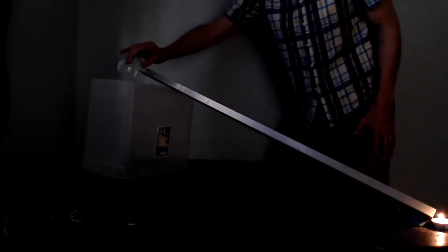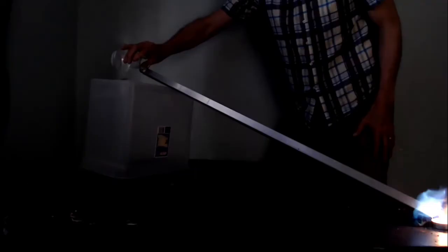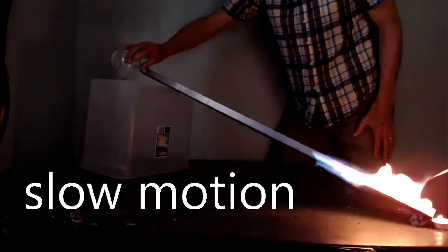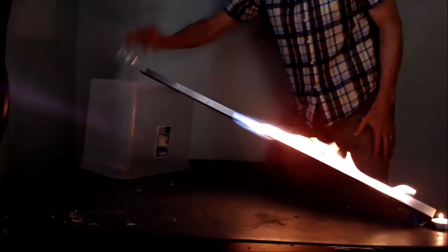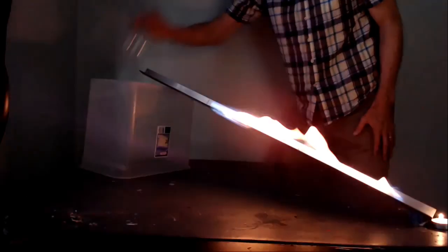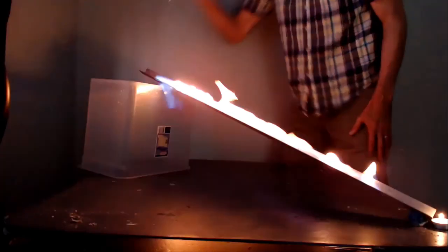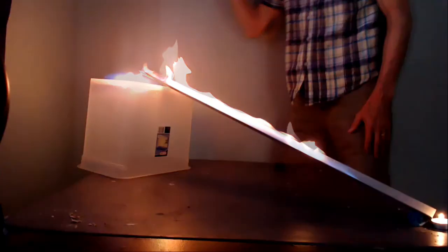Pouring it, pouring, pouring... and there it is.